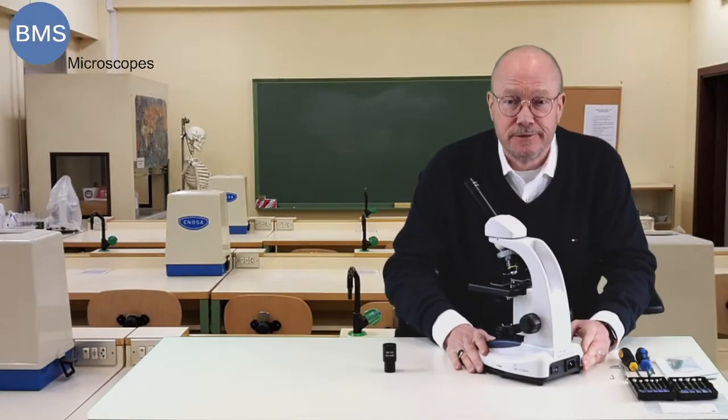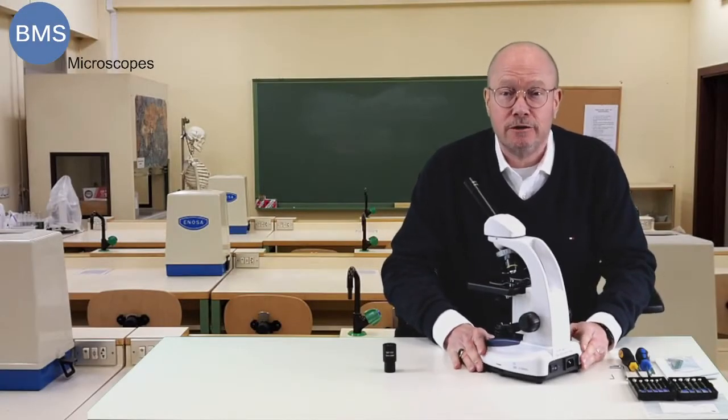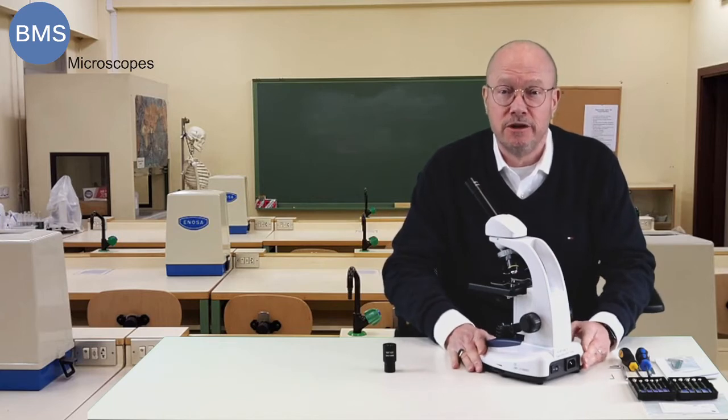Welcome to BMS Microscopes. Today I would like to show you how to remove an eyepiece and put another eyepiece in there.